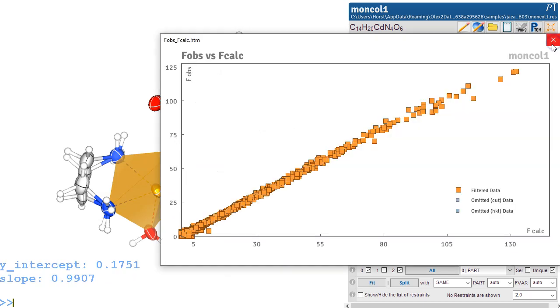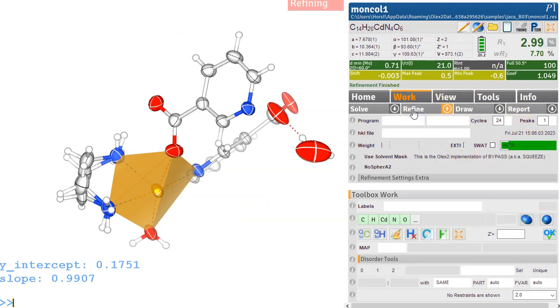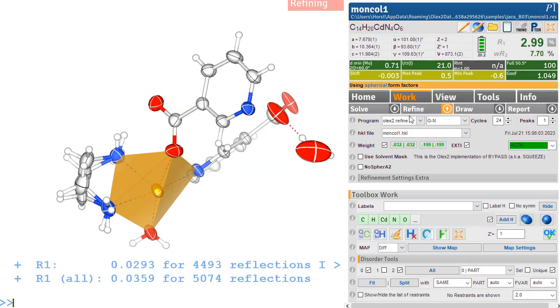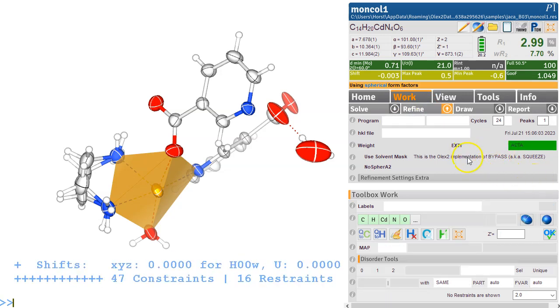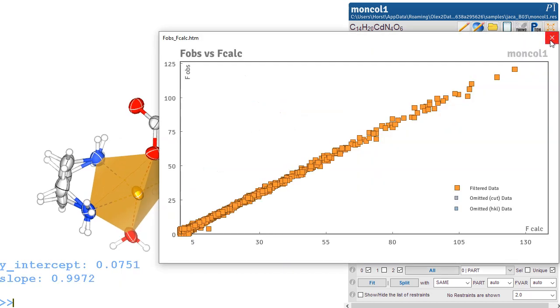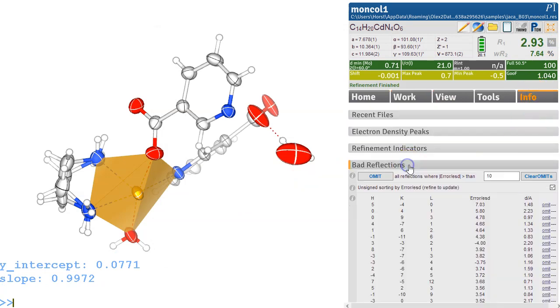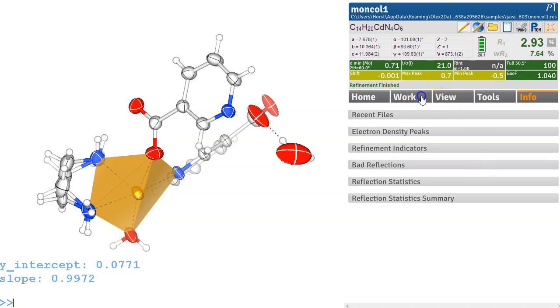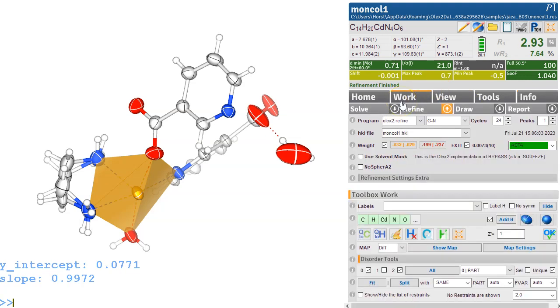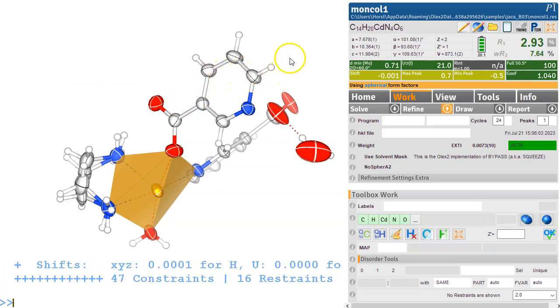Now let's look at the Fobs Fcalc. There's a couple of outliers and maybe there's a little bit of extinction going on. Let's try that as well to see what we are getting. So the value here comes out as 73 with 10, so that's definitely valid. That should look more straight, and it does. Well, it's an outlier. It's a very weak reflection. It's not going to make much difference. We can also check for outliers over here, bad reflections, and there is nothing showing. Right, so one last refinement set, and I think we are done with that structure.